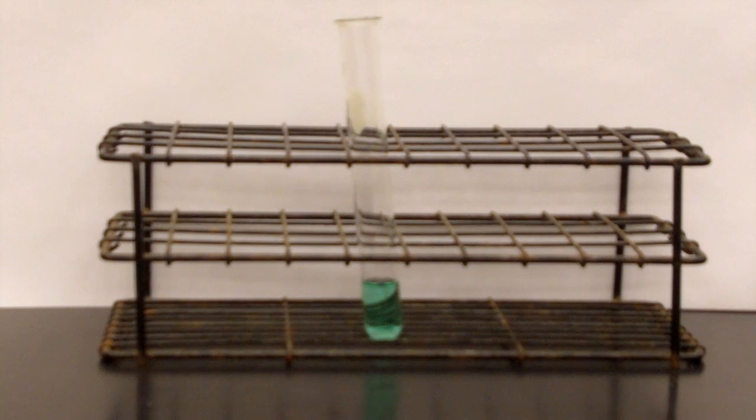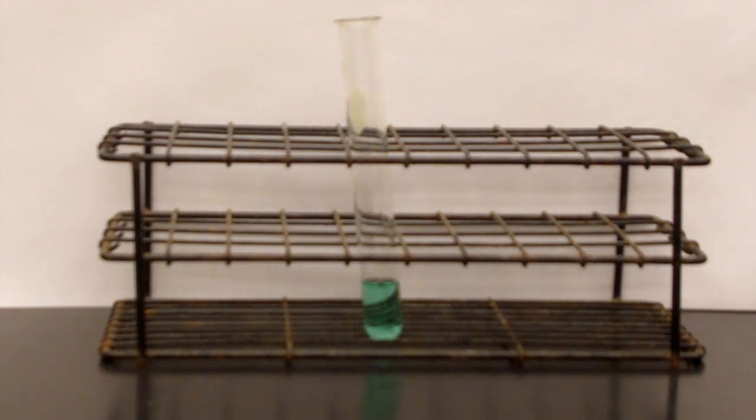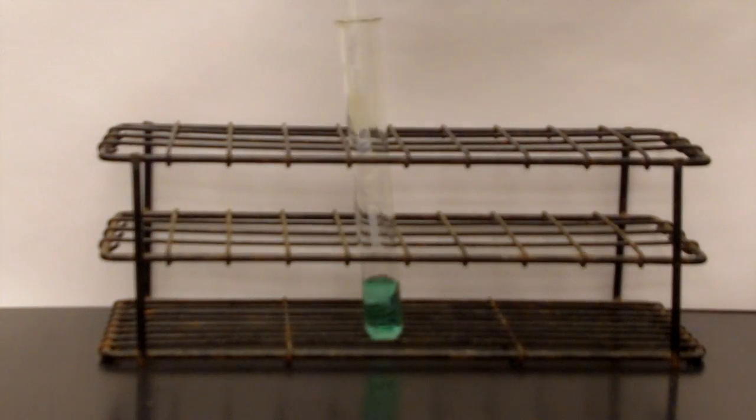Now we have a solution of nickel chloride, and we're going to react that with some sodium hydroxide.